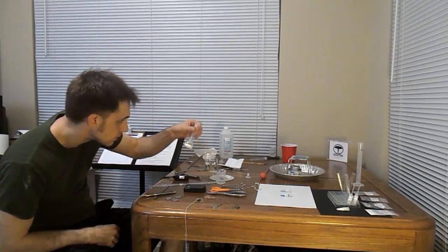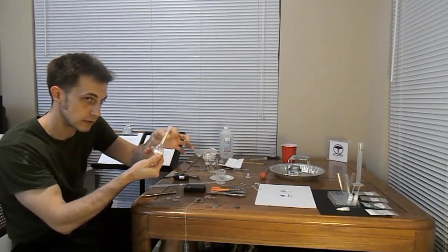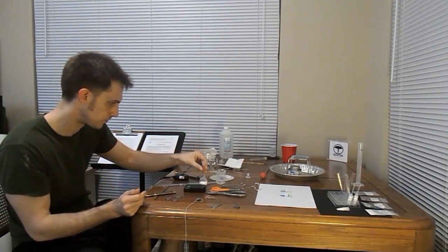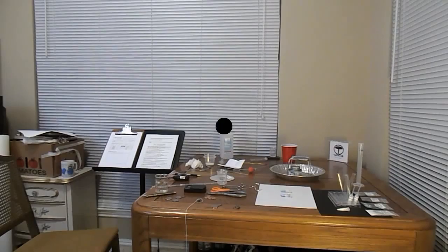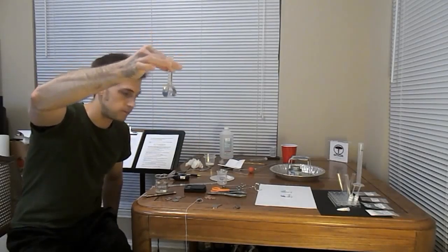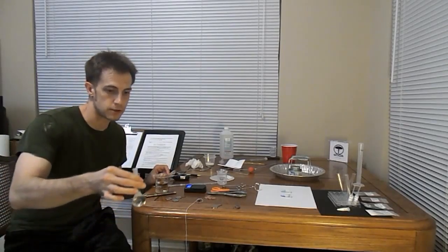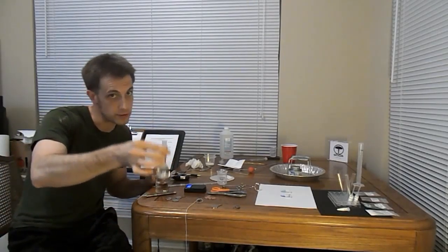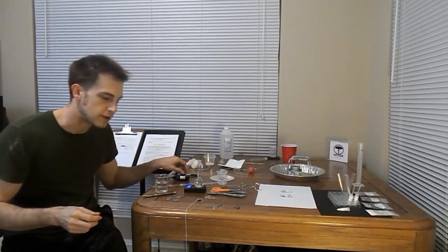Alright, now we'll be filling this to the 25 milliliter mark, which is that lovely mark you can't see right there. For time purposes, we're going to do a couple steps off camera. Alright, a couple steps later, now we have this lovely solution of sugar water, and we're going to go ahead and start making some calculations for a dilution series here, or at least recording some data. Won't bore you with the calculations.